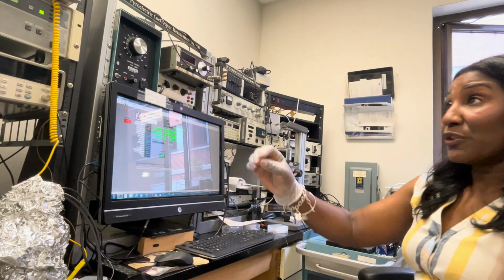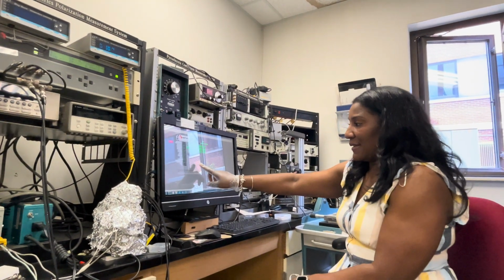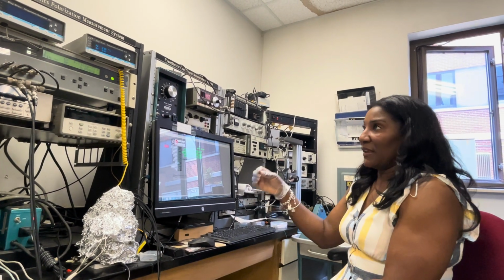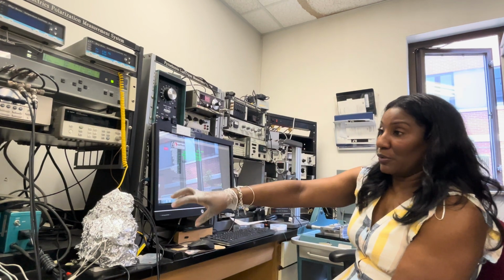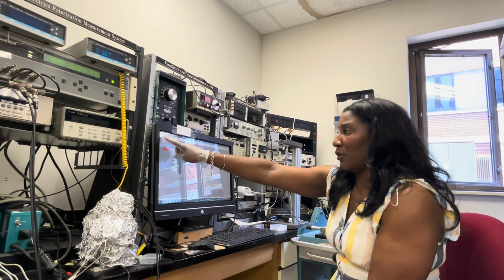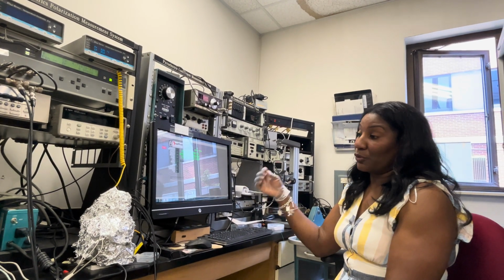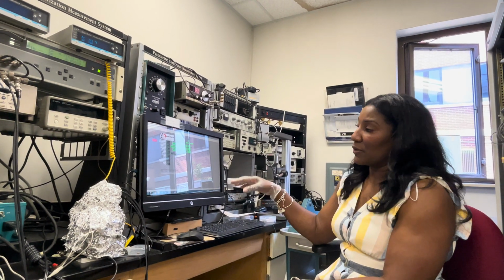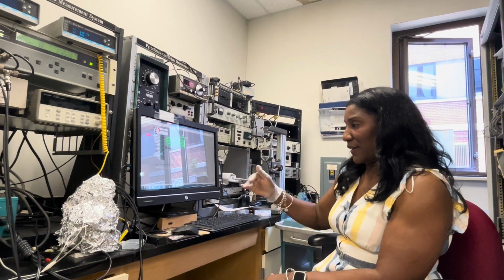And we know that once the temperature has increased to 35, and I hit take data, it's going to write to that file, which is what we want. So again, once you set your temperature, you're waiting on the temperature to increase in your chamber. While you're waiting on that, go ahead and hit your run button. It's going to then step you through the steps to create the actual file name. Go ahead and do that, and make sure you add that temperature at the end, so that as you're looking at your files, everything is very, very clear to you.